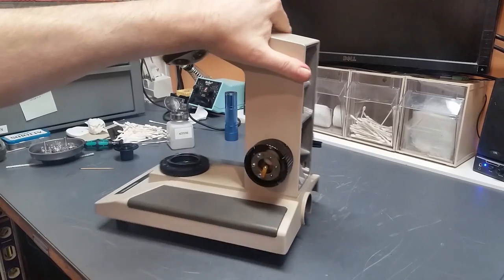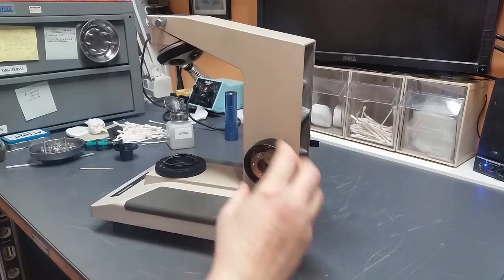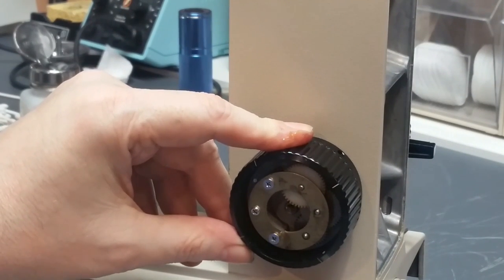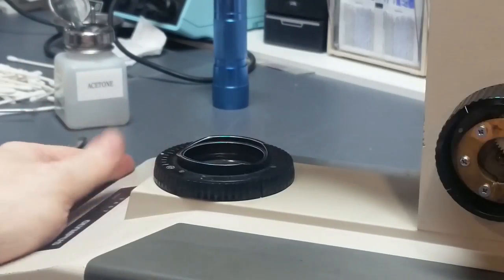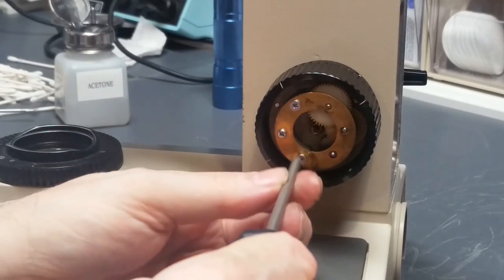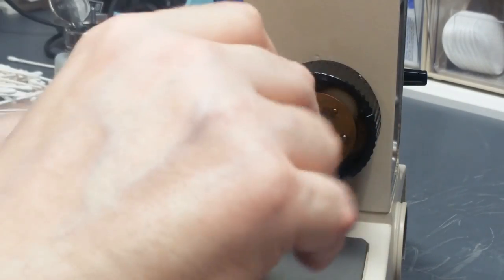And I guess I lied. I said we were going to be installing it. Look at all that grease that came out. I said we were going to be installing it, but before we do that, I want to disassemble this gear cluster here. Get you over there so you can see it. I want to disassemble this gear cluster here and clean that all up. Don't want to forget that. Be a shame to do a whole rebuild and then forget to do that and leave that old grease in there.